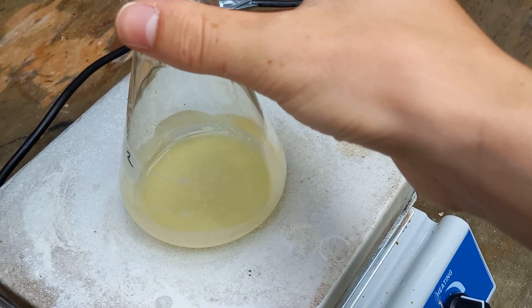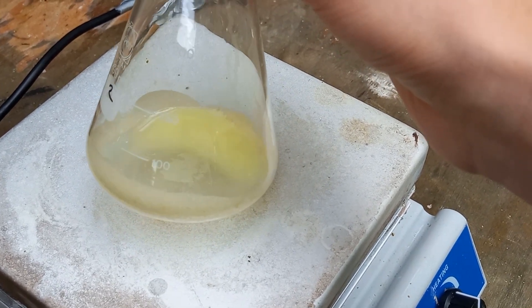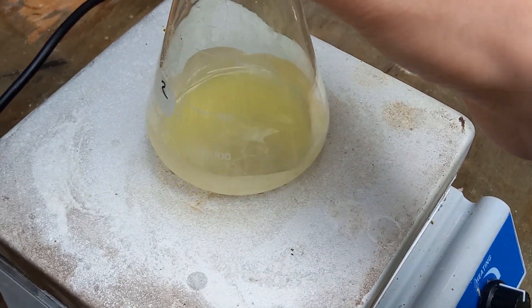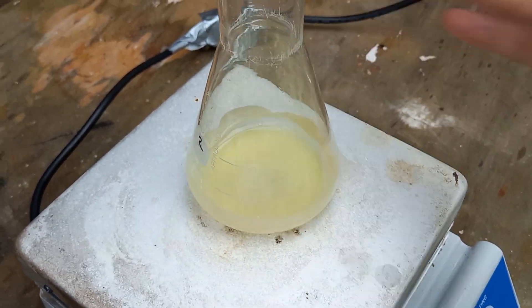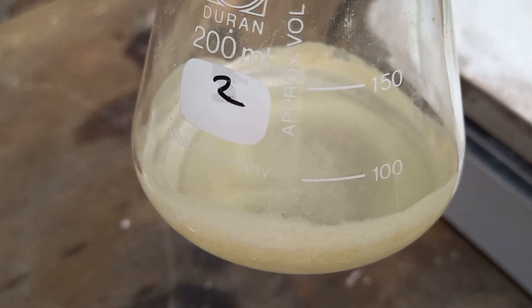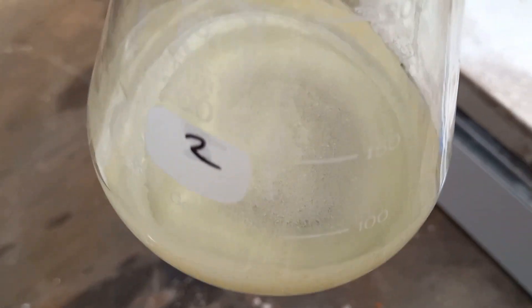I'm almost done boiling it, but the last bit of water is kind of hard to get rid of. It seems like it's slowly turning more and more yellow — that can't be good. The camera doesn't really pick it up but it's quite a lemony yellow, quite vibrant. I hope it doesn't explode or something. So I just took it off the hot plate because it wasn't boiling off any water — it was just melting the salt. It's amazing my glassware didn't break. It immediately solidified, and there doesn't seem to be any water left in there.